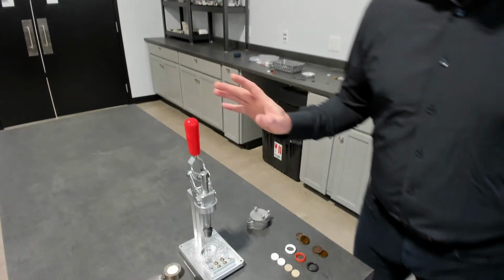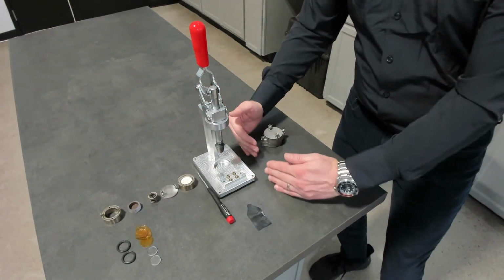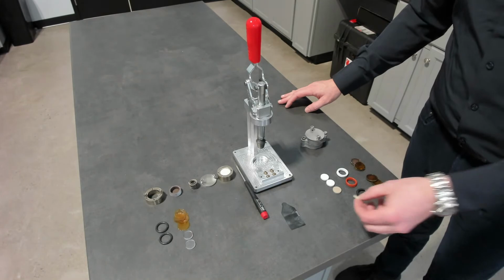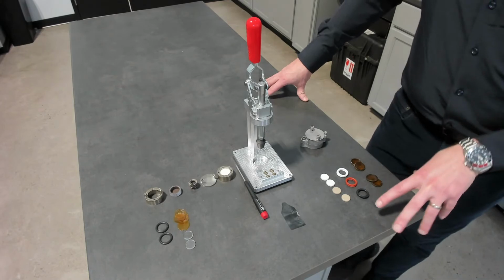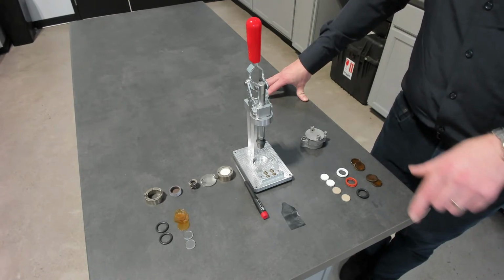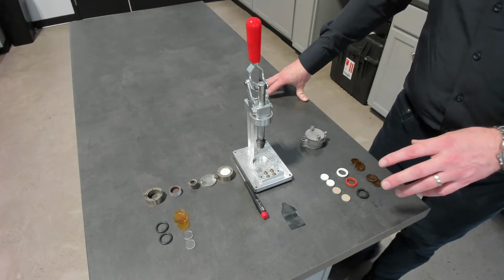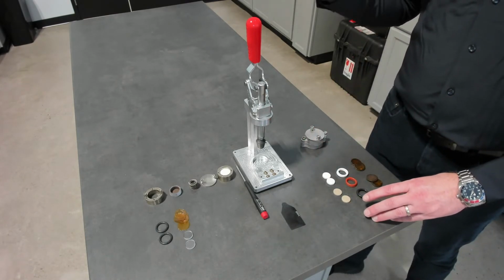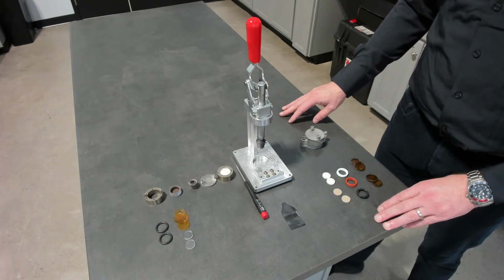Okay, so we're going to move over to the table here. This is a little snapshot of the sample cell kit. To this side of us are examples of polymers that you can measure through the melt. So what we've designed is a sample cell that can be used from cryogenic all the way up to 300 or 400 Celsius. We've developed the necessary components to be able to achieve those ranges. And you can measure that from the melt, so from a high temperature to a low temperature, then back to a melt. So you can develop the two directions in temperature control.